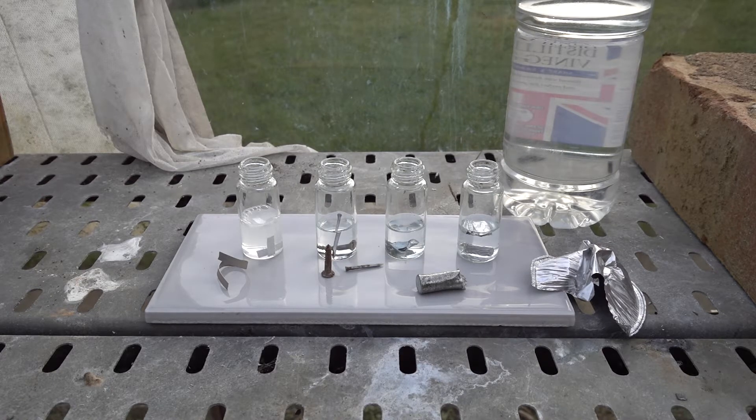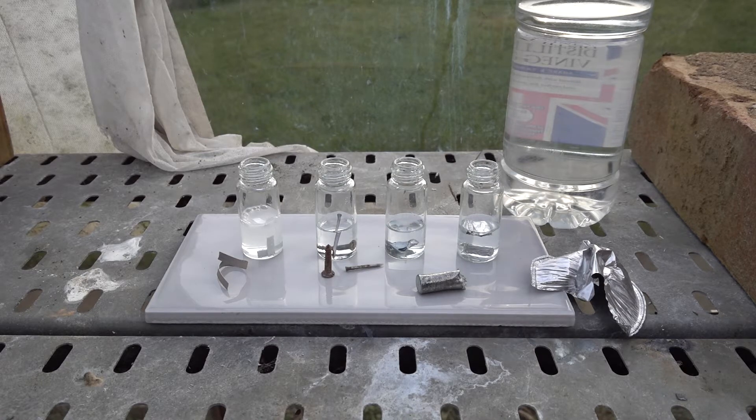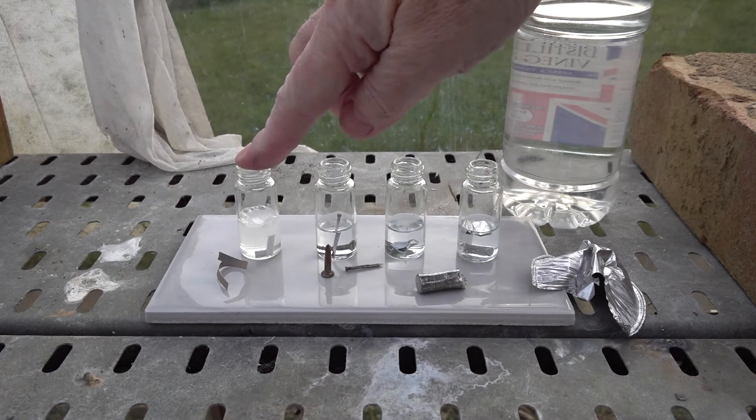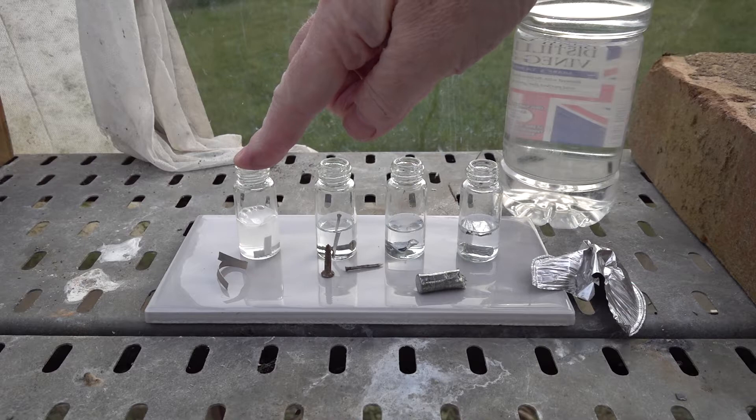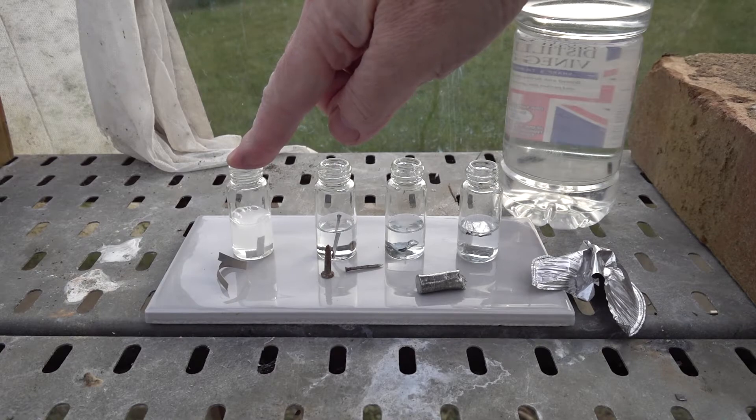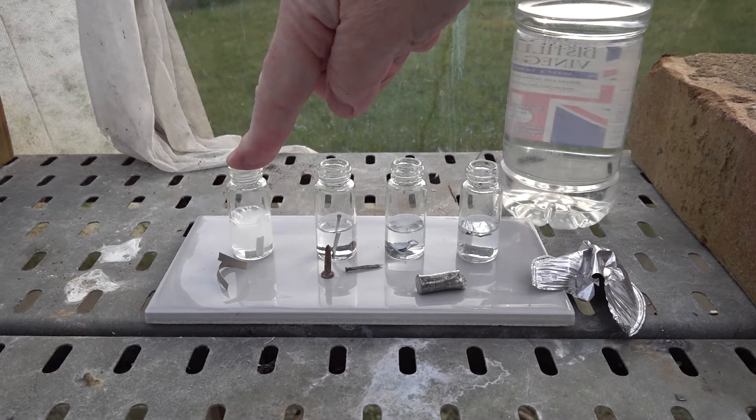We can of course test the gas given off by the magnesium. We have a lighted splint. First we need to trap it. We need to wait for a sufficient quantity to test.